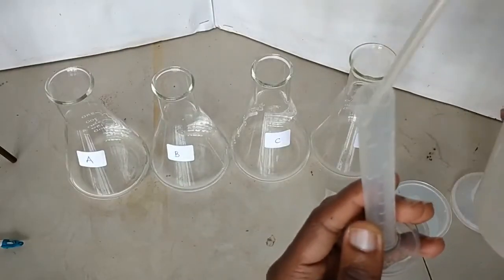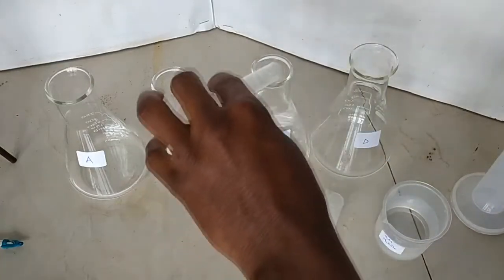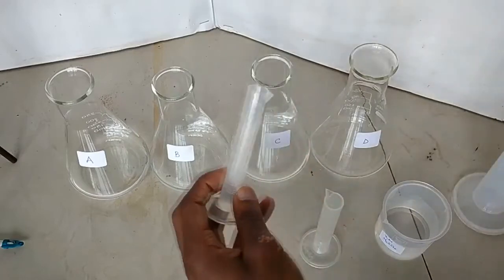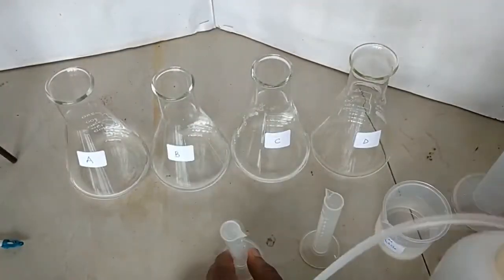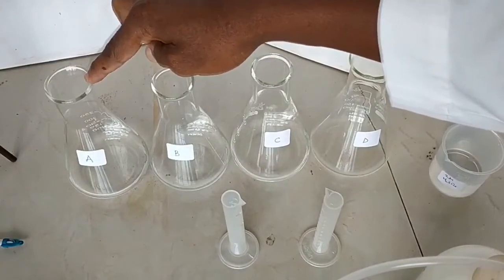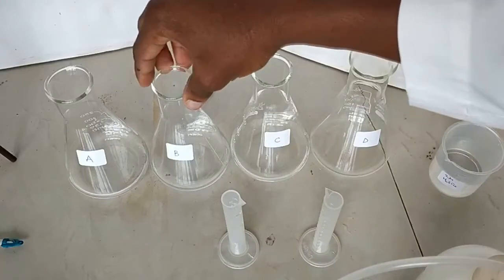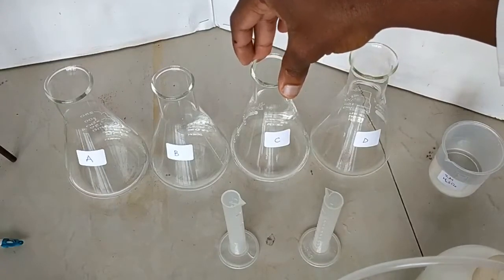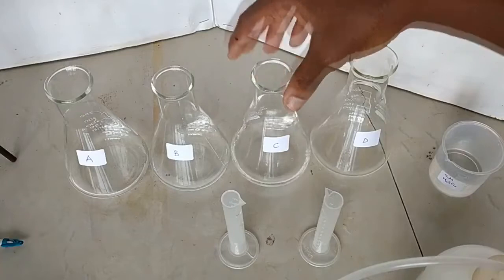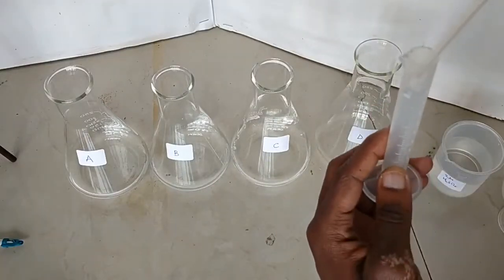In flask C I'm going to add 20 — that's 10, I need to add one more. All right, that is 20. So now flask A has 40 cubic centimeters of 2 molar sulfuric acid. Flask B had 30 centimeters cubed of 2 molar sulfuric acid with 10 cubic centimeters of distilled water added, making a total volume of 40. Flask C had 20 cubic centimeters of 2 molar sulfuric acid plus 20 cubic centimeters of distilled water — I'll swirl to make a homogeneous solution.